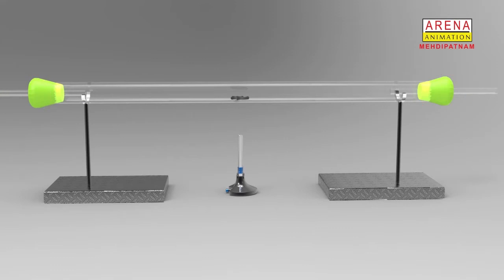Now pass hydrogen gas over the copper oxide and wait for some time. Now light the Bunsen burner and begin to heat the copper oxide in the tube and observe the changes. When all the copper oxide looks like copper, keep heating for a further minute or 2 and then remove the Bunsen burner.